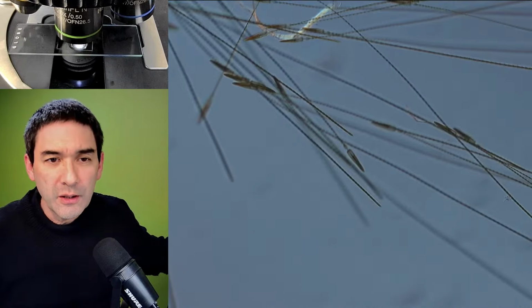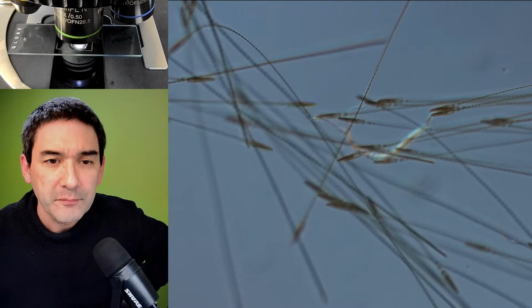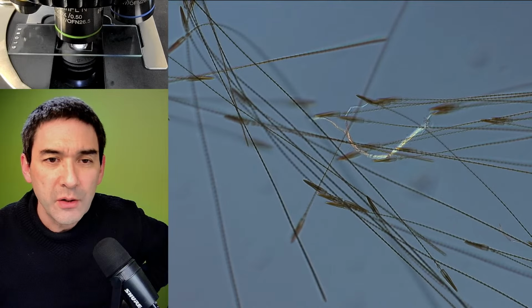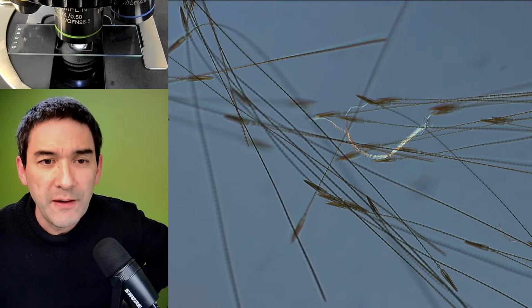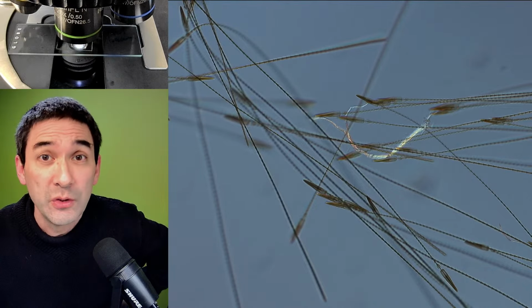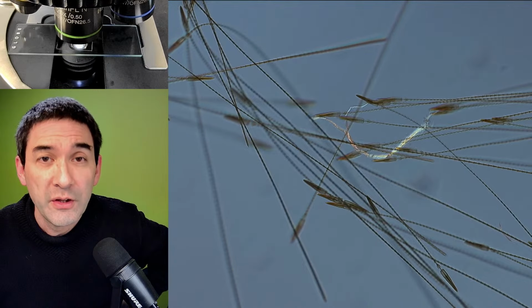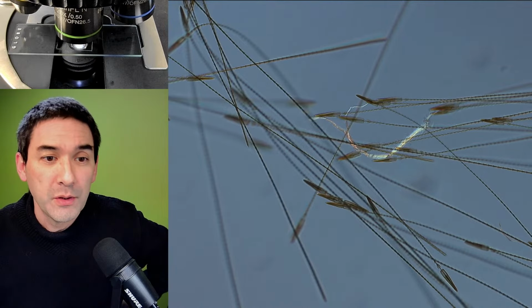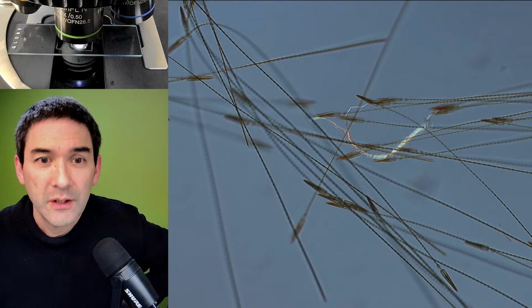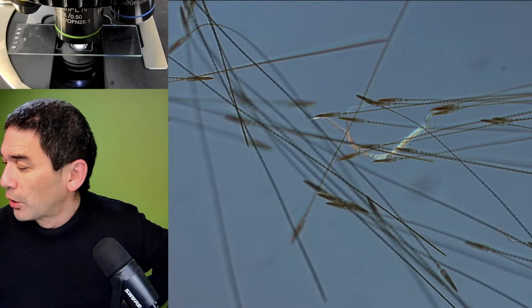What you see over here, those structures, I made this a few weeks ago also during a live stream. These are the bristles of the carpet beetle. I think they seem to be some kind of defensive structures. Several years ago, I found individual ones in the dust and had absolutely no idea what they were, until somebody in a German microscopy forum told me. In German, for those of you who speak German, it's called Pfeilhaare, basically arrow hair, because they kind of look like arrows, and these are defensive structures of the carpet beetle.